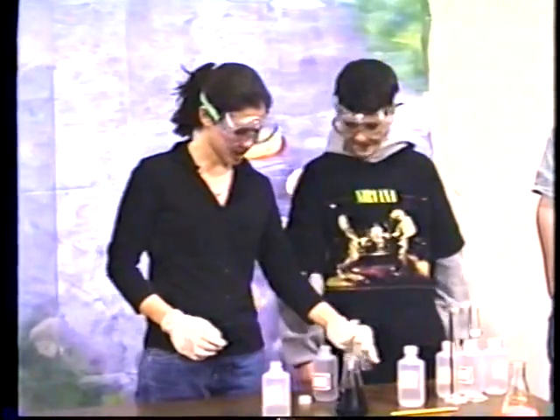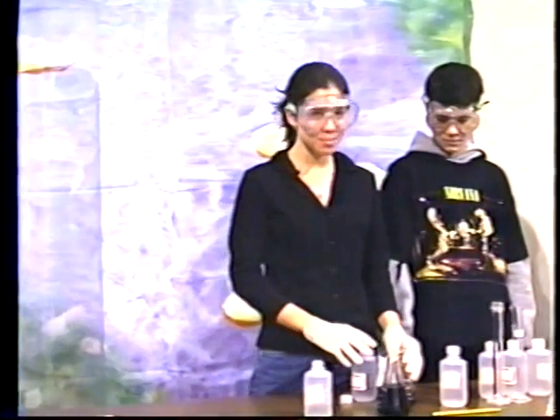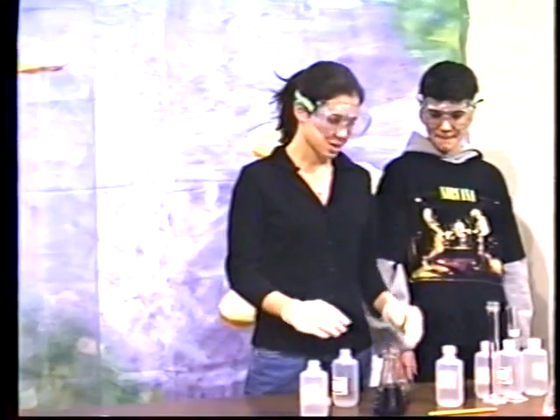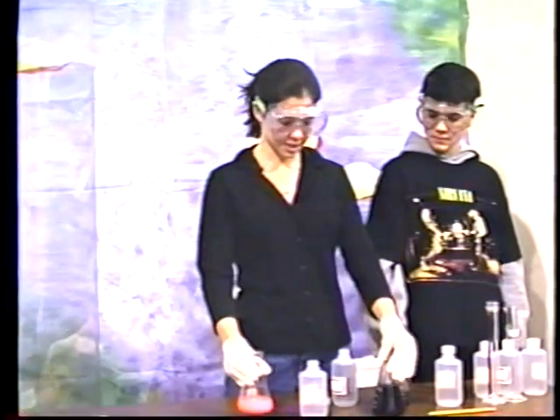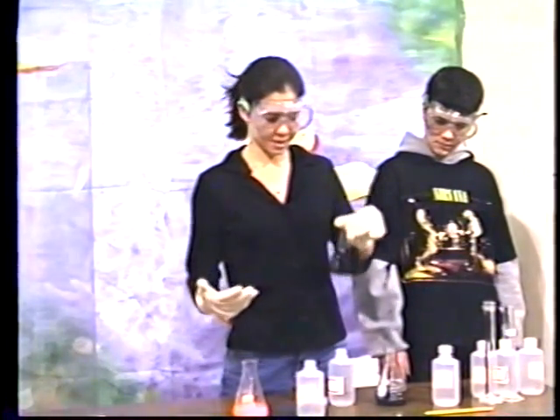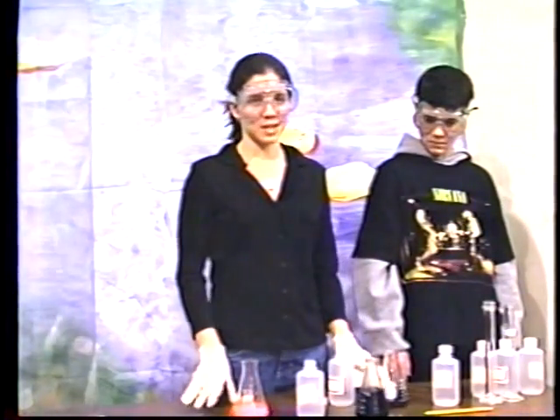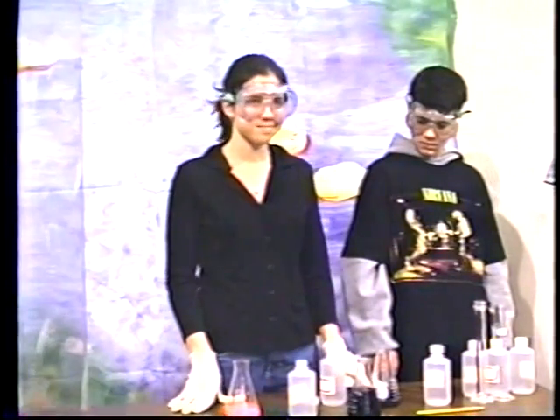Thank you. Okay. As you can see, we've got a few different reactions going on in these bottles. They are all the same chemicals that we added together. They're just in different concentrations. There's different amounts of each chemical. So in this first reaction, there was one reaction which produced an orange color. In the second reaction, there was a different reaction, but it produced a black color because there were different concentrations. But in this third reaction, both reactions took place, so the orange and the black both occurred. And it's called the Old Nassau Clock reaction because Princeton colors are orange and black, and Nassau Hall is a building in Princeton.